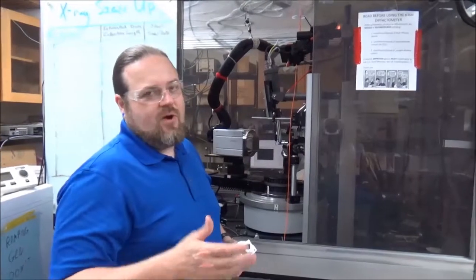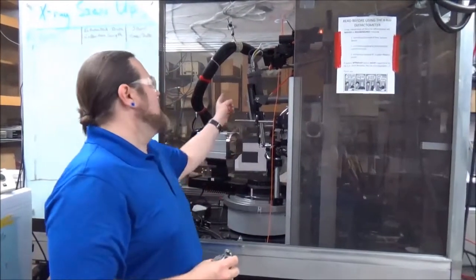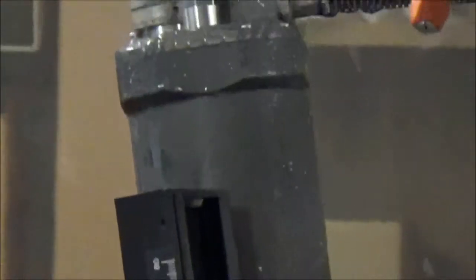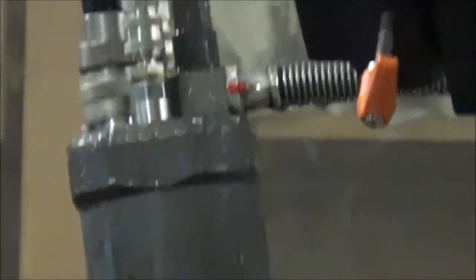Today we're going to do a quick video. We're having some problems with the cryo. As you can see, the cold head here has a bunch of condensation all over it. We're having trouble bringing it to temperature, so that indicates the problem is likely that the cold head needs to be pumped down.